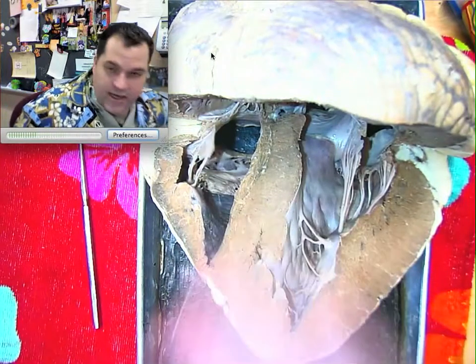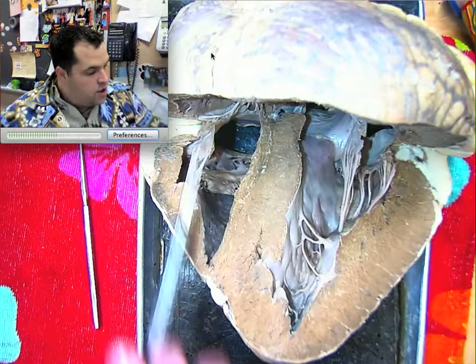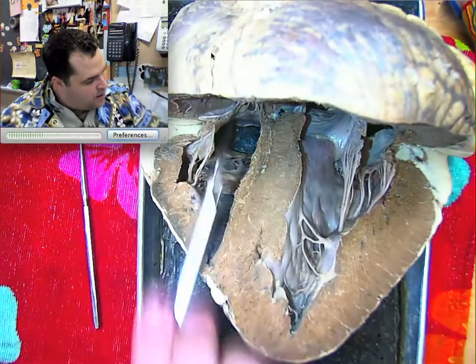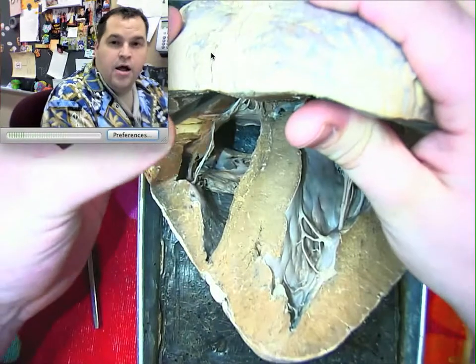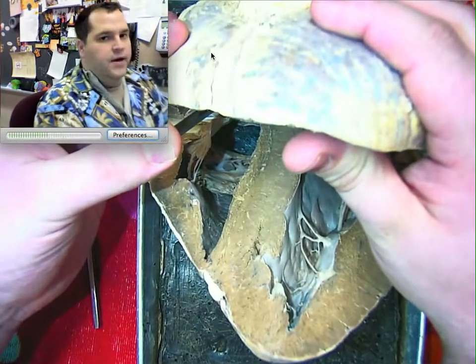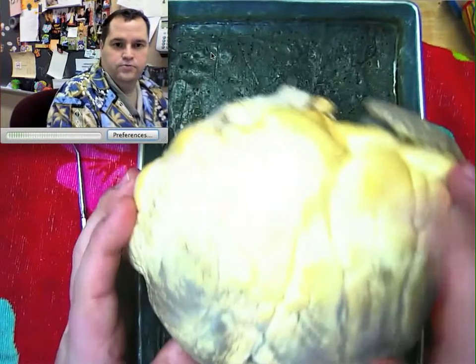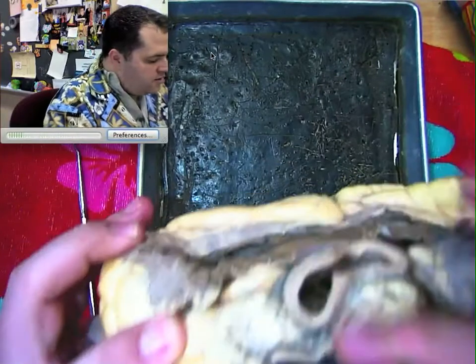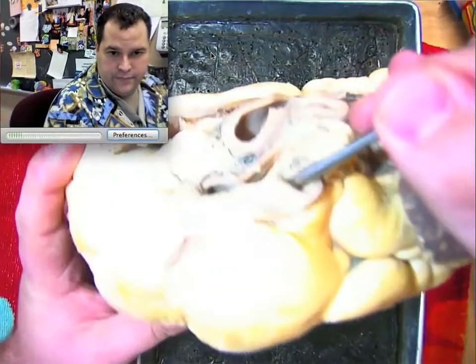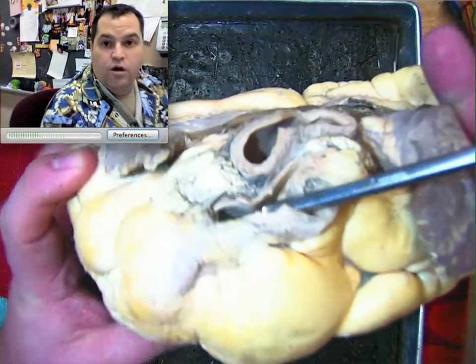So this is, of course, the right ventricle. Now, the blood vessel is going to go out that way, right? So we're going to pump, right? So if I push my probe and I close the heart, my probe should be coming out of the pulmonary artery, because that's where the blood is flowing. And in fact, if you take a look, whoop, there it is. If we take a look at the top of the heart, this structure right here is in fact the pulmonary artery.